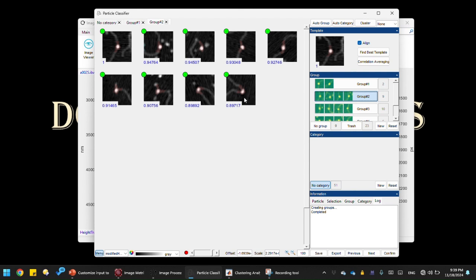So what does this tell us? It tells us that it's not good for analyzing or classifying the DNA bending conformations. What it does is classify the particles according to the size of the proteins. Basically, the correlation runs a cross correlation between two images, or between two particles, right? And the cross correlation uses the intensity values, or the raw data of the image, for its calculation. So you can imagine that the protein takes the largest share of the data because it's tall. That's why during the cluster analysis, it's classifying the particles primarily according to the size of the protein, and not according to the shape of the bend of the DNA.